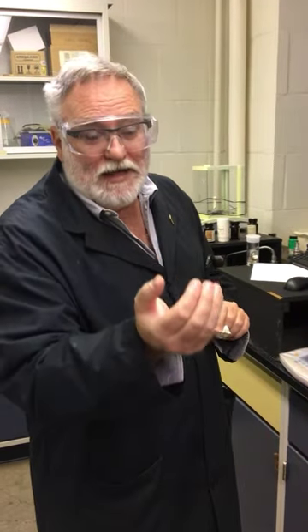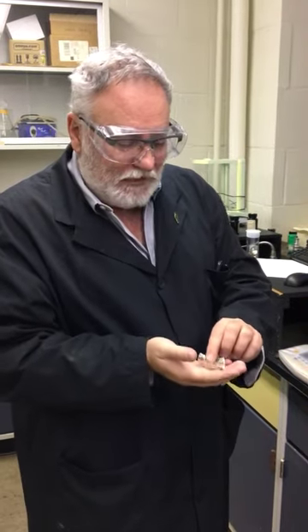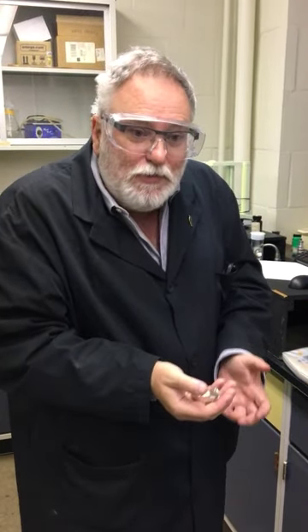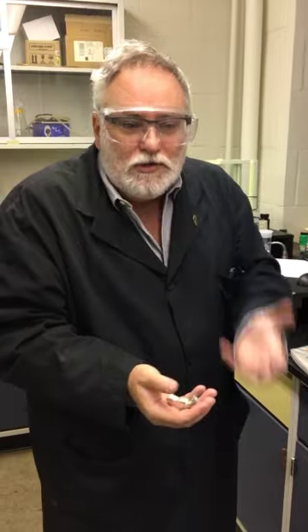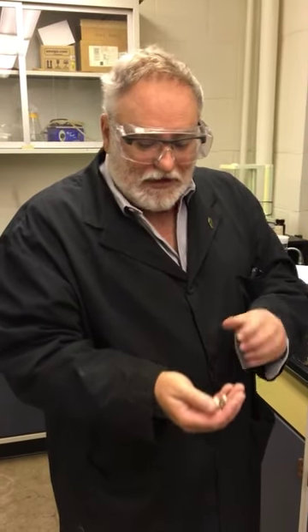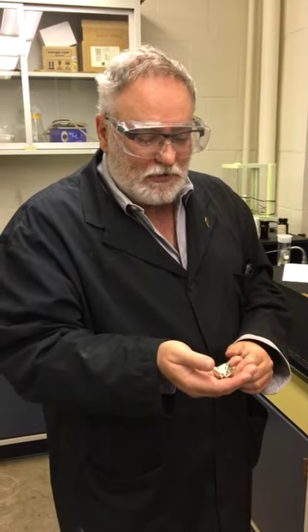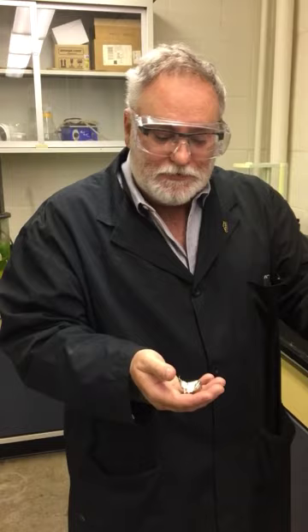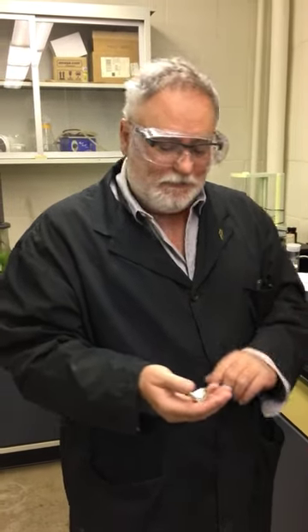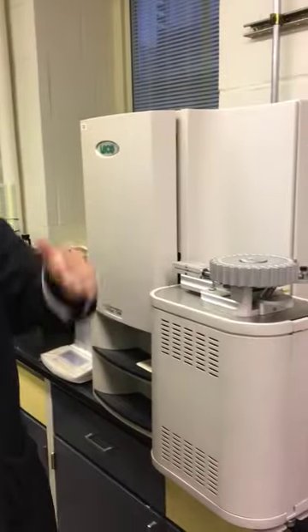But we also have inorganics which are going to again artificially boost or reduce all the data, because I'm not just looking at the coal organic material, I've also got the inorganics. So I need to know what that data is from the proximate analysis so it can be corrected. So the sample is placed in here, scrunched up so it fits in the auto feeder, goes along, we've done conditioning runs, the sample is sitting on a shelf.